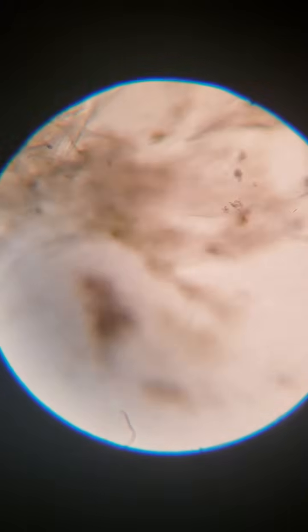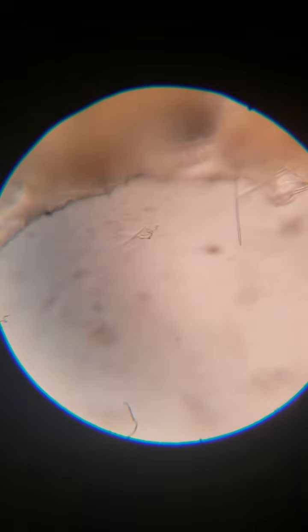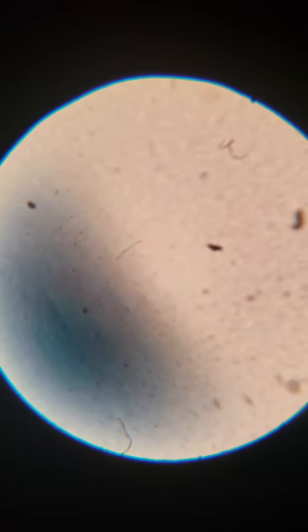And this specific species is known as Ephydatia muelleri, or Muelleri, whatever. I'm bad at pronouncing these sometimes. I never know what they want from me with all the eyes they put in place. All right, so let's zoom in to the max. All I can give it. I can't give it any more juice. Let's see here. It's hard to get it in focus when we're this close. But we have a nice swath of sponge that I killed for you guys, unfortunately.